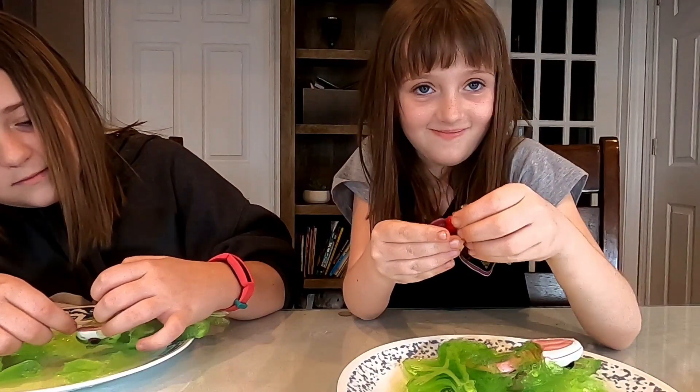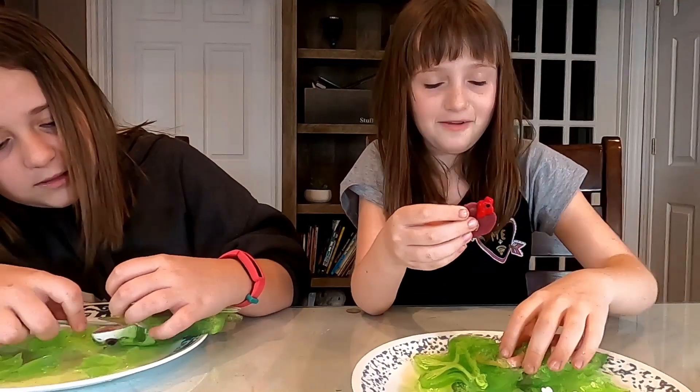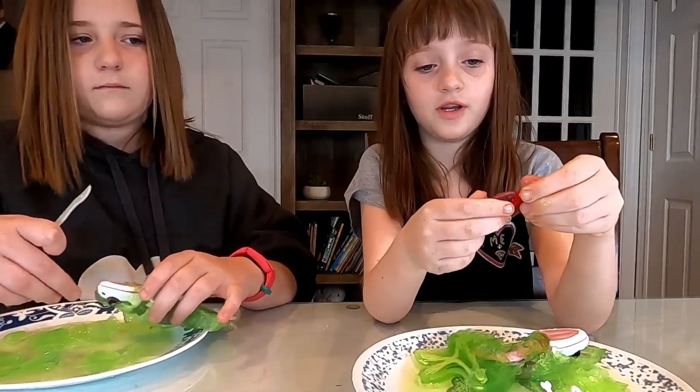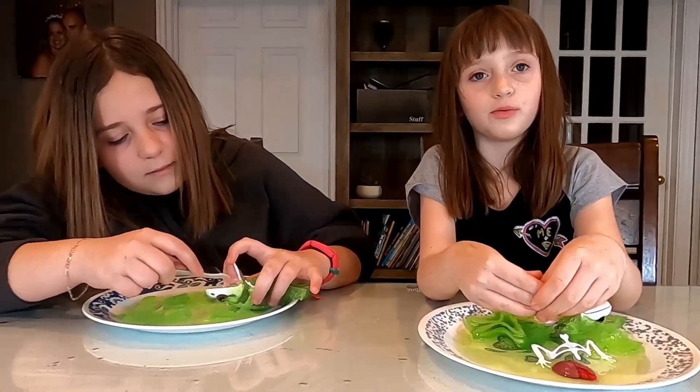One point Miley, zero points mom. That was actually the heart. There's a little bit of gelatin inside — it looks like the heart could be on the top part. The heart is here and then the lungs are underneath it. And what do your lungs do for you? They help you breathe.